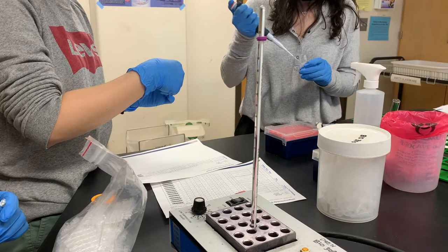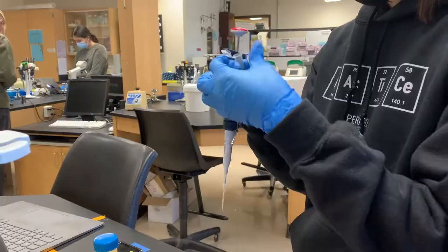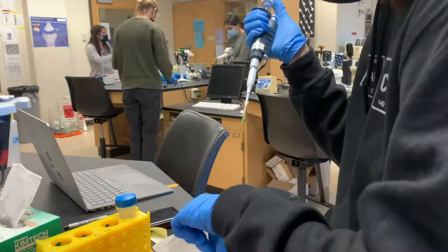The TA helped us add primers needed. In my case, I had two invertebrates, so I used LCO1490 forward primer and HCO2198 reverse primer.